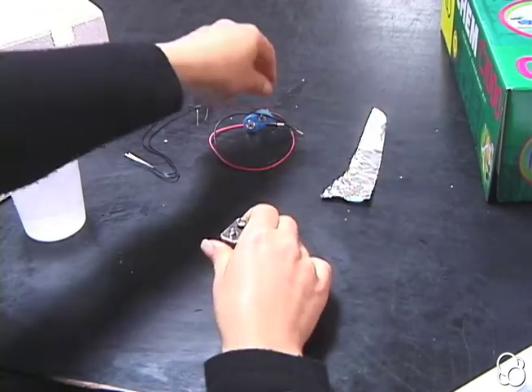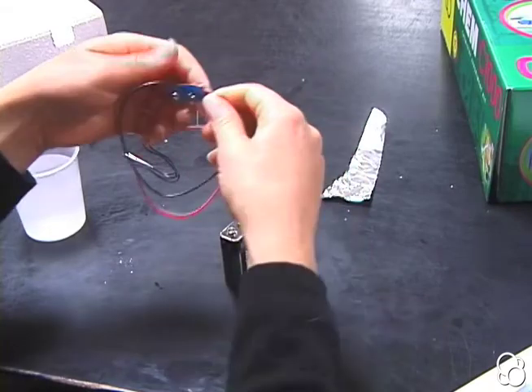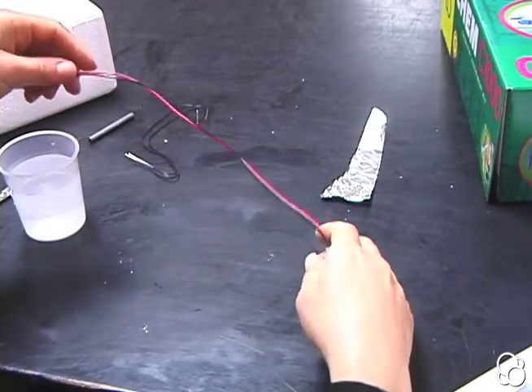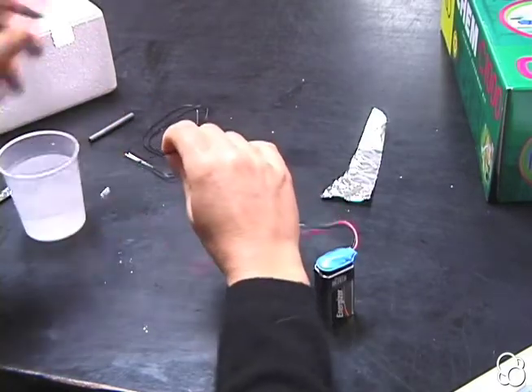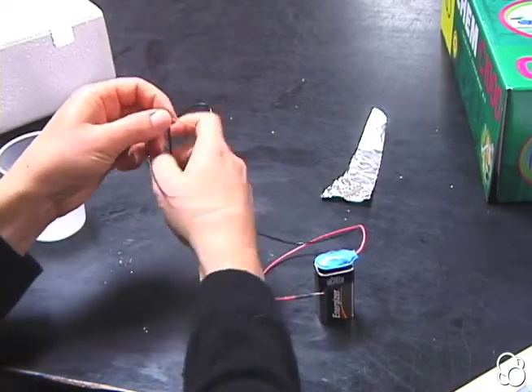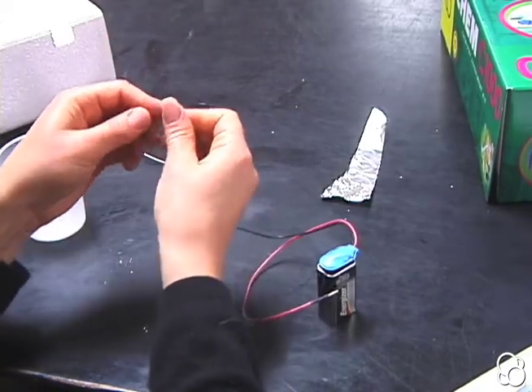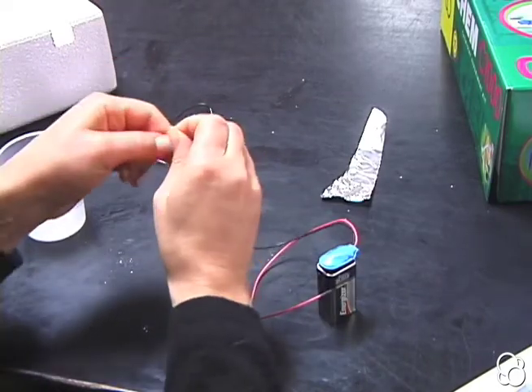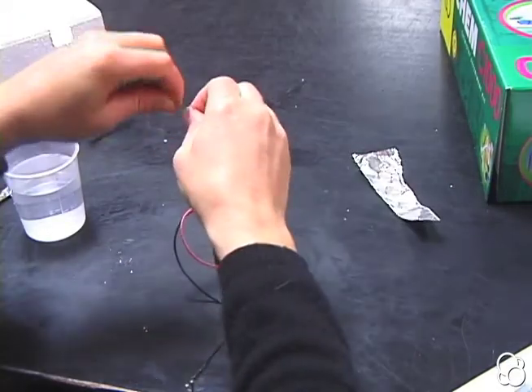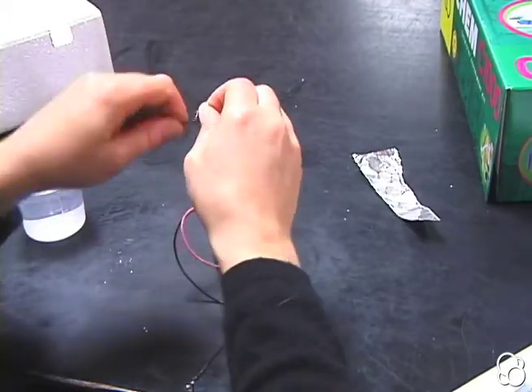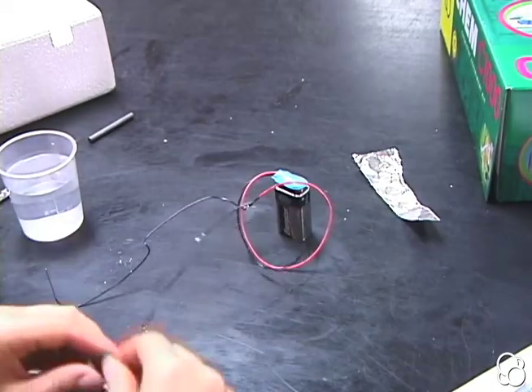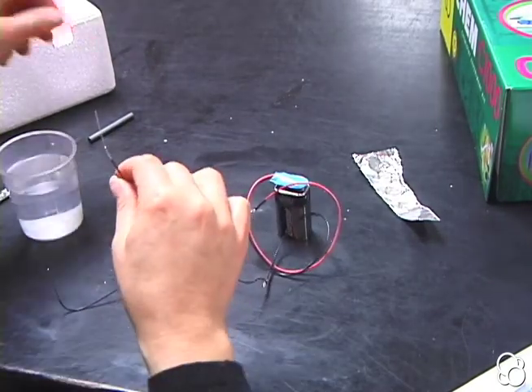Then we're going to take our battery clip and attach it to the battery, and then attach these two wires to these two wires. We can just wrap the coil around on both sides, and then attach one of them to the carbon rod.